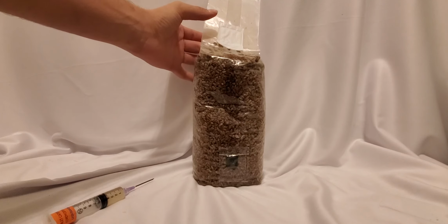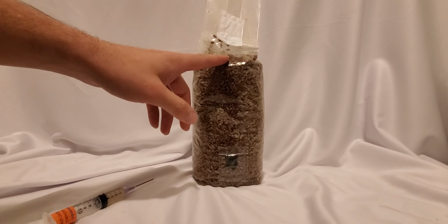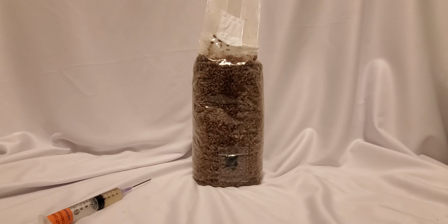And then once you have inoculated it, turn it back normal and the liquid can drain back down and it'll prevent any pooling. It's a pretty good way to do it. I would recommend more people do it this way.